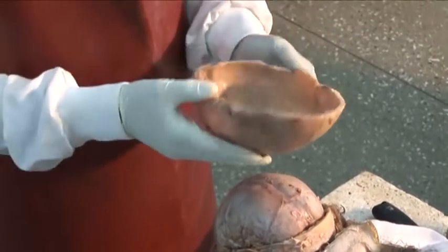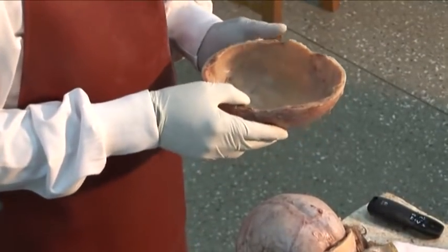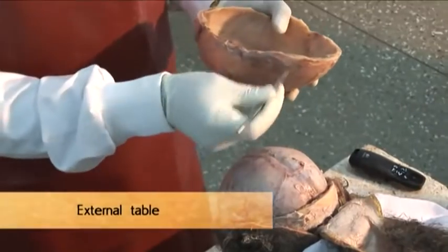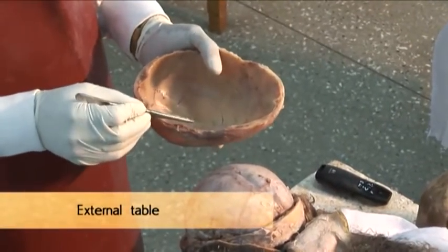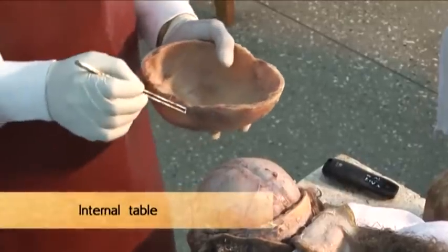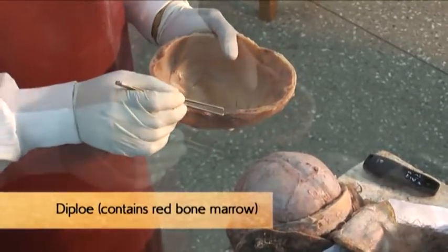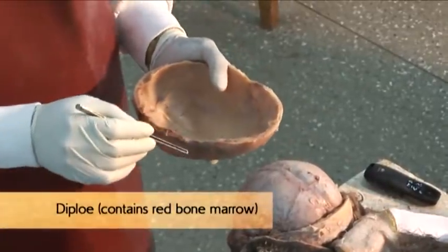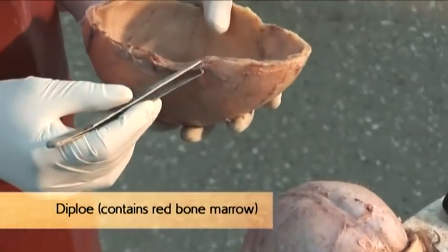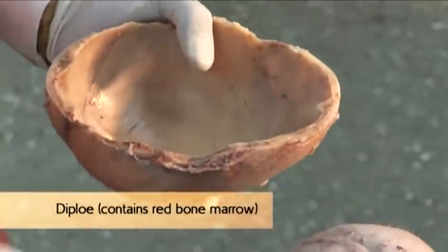We discussed the external surface, and that is the internal surface. Within the internal surface, the following can be identified. We have the external table. You have the internal table, which is made up of cortical bones. Then we have the inner bone marrow, or the diploe. The diploe contains bone marrow, which produces red blood cells. So the extent of the diploe is much wider in people with sickle cell disease, where production of red blood cells continues.